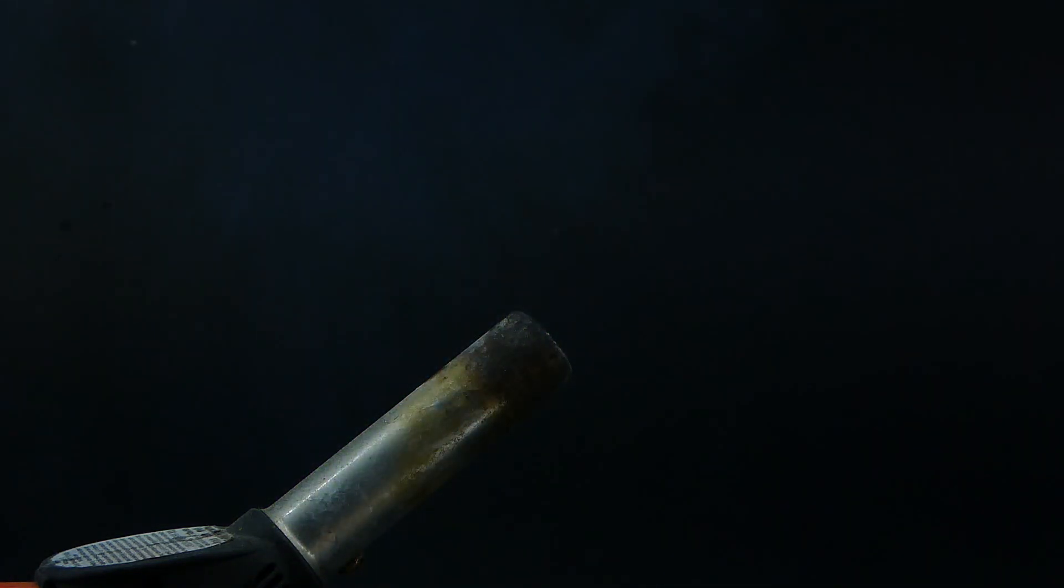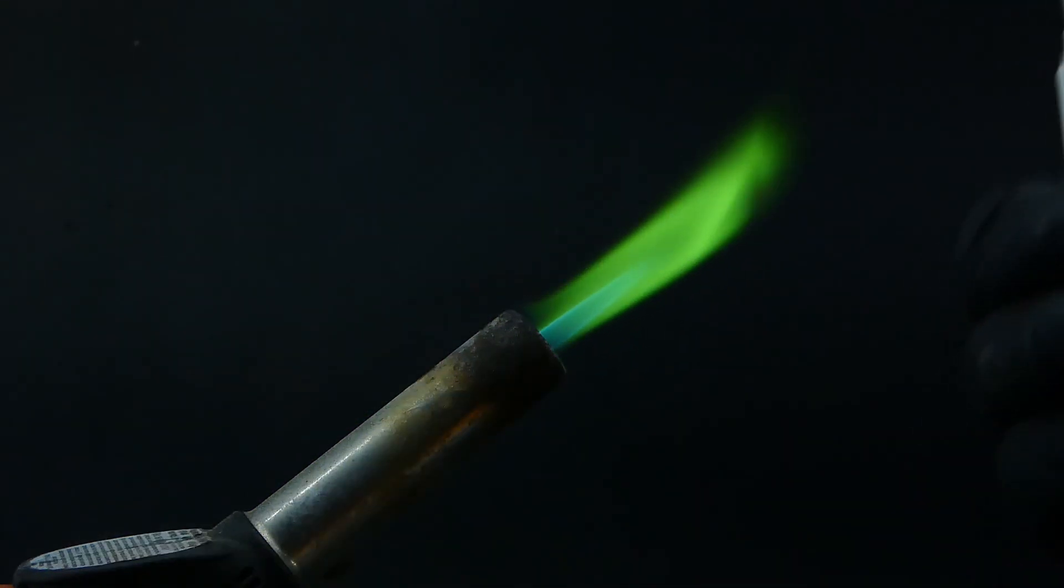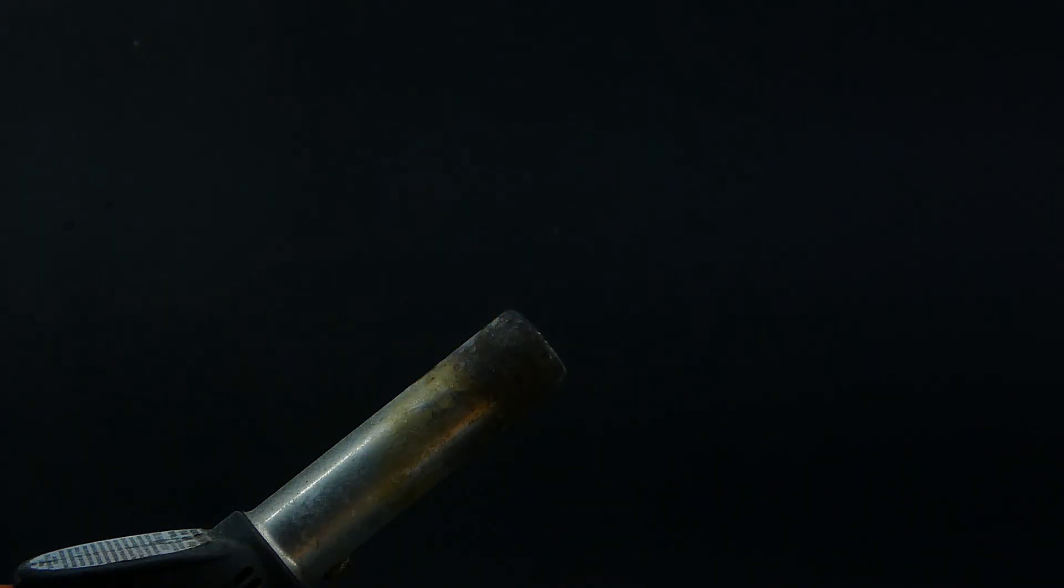It looked really nice, but also generated lots of methanol vapors, which I really didn't want to breathe, so I had to do this in my fume hood.